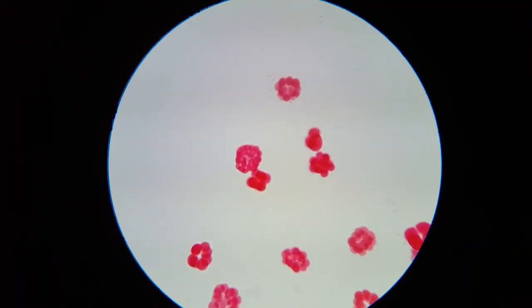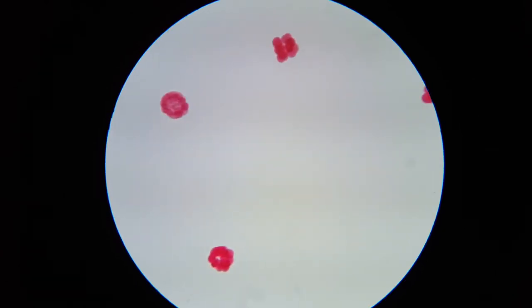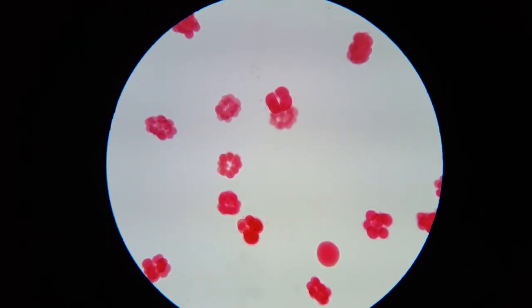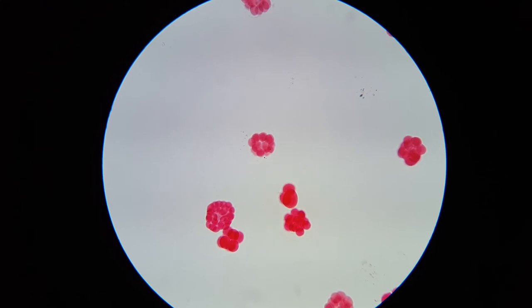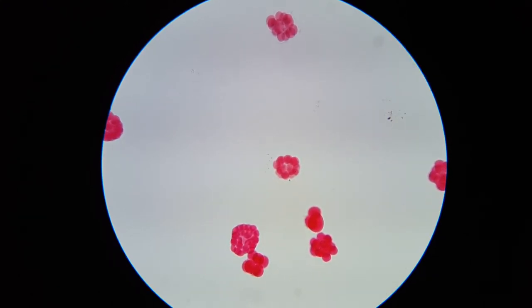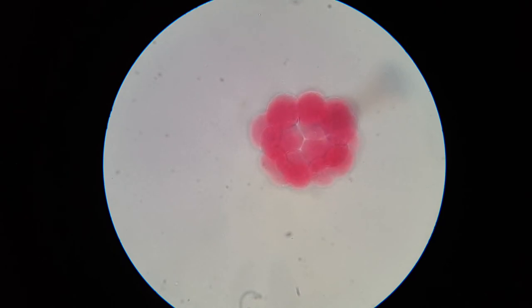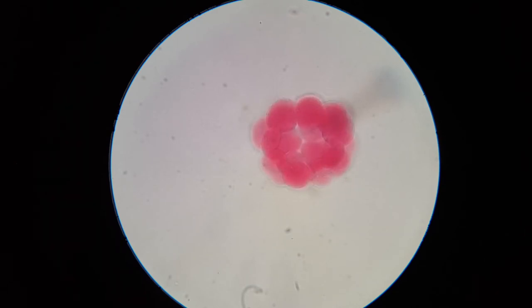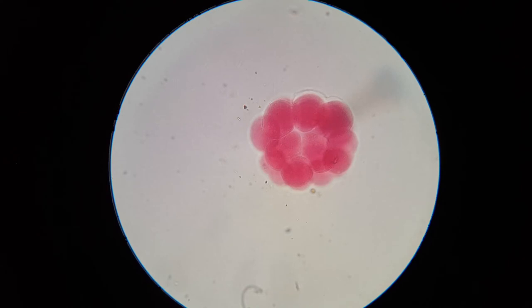We're going to switch down to the 10x objective to get a better sense of what's out there, looking for something that's clearly 16 cells. We'll center on that one and put into place the 40x objective. Does that look like 16 cells? Arguably, you've got eight or so on top and eight or so on the bottom — so roughly 16 cells. As you get more cells, it's difficult to see exactly what's going on.